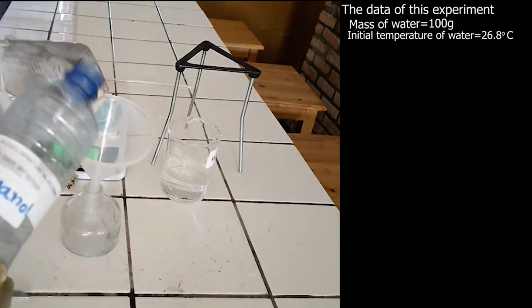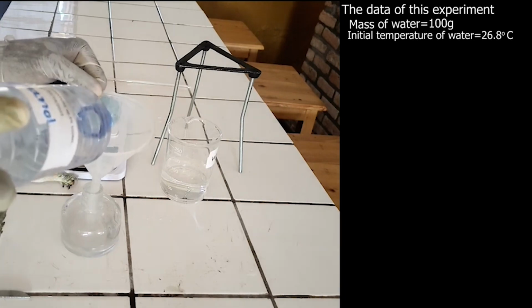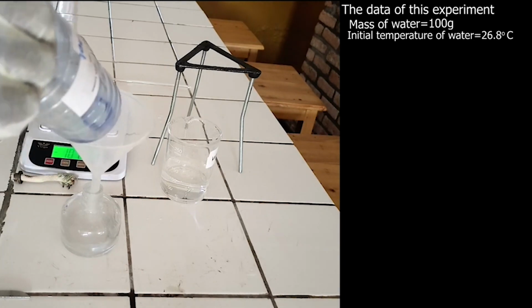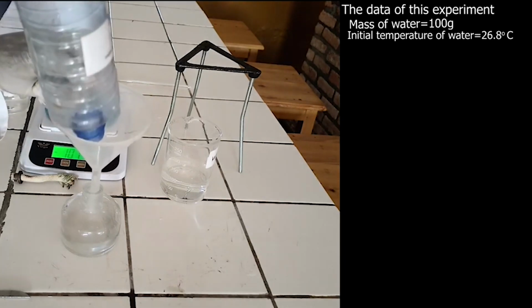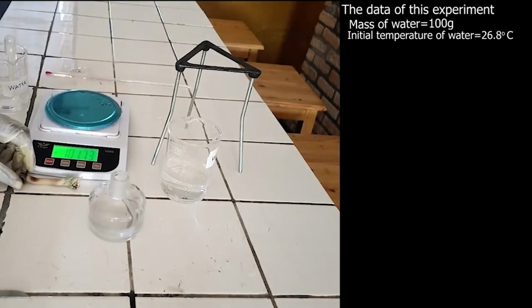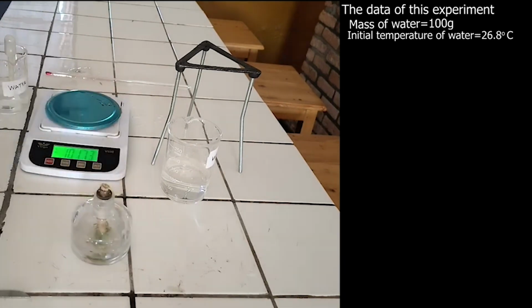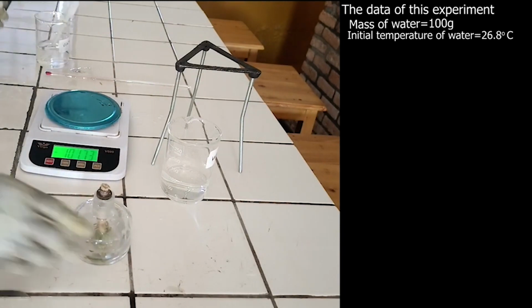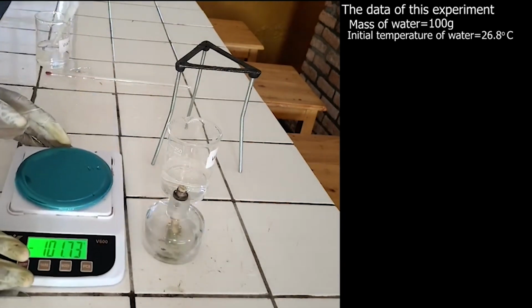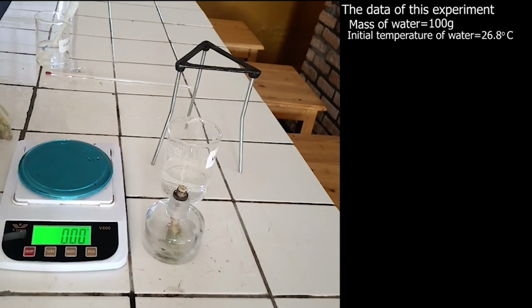By using a funnel, pour ethanol in the spirit burner. Set balance to 0 and weigh the mass of both the spirit burner and ethanol.